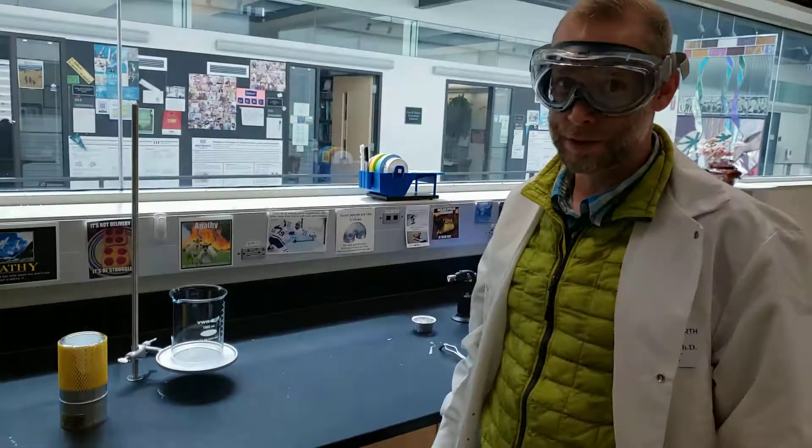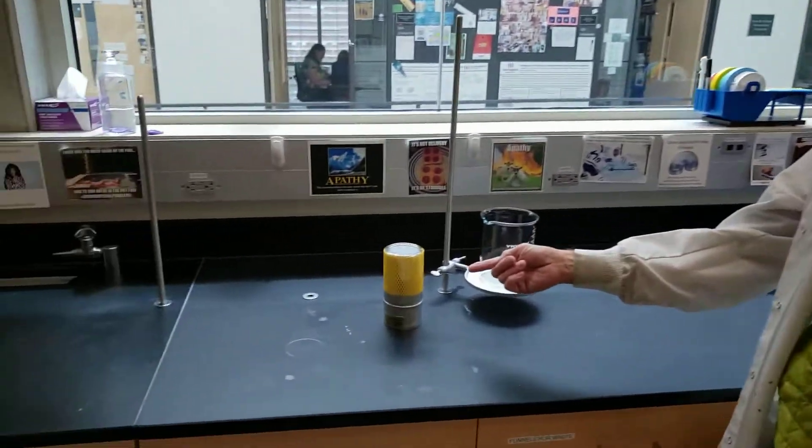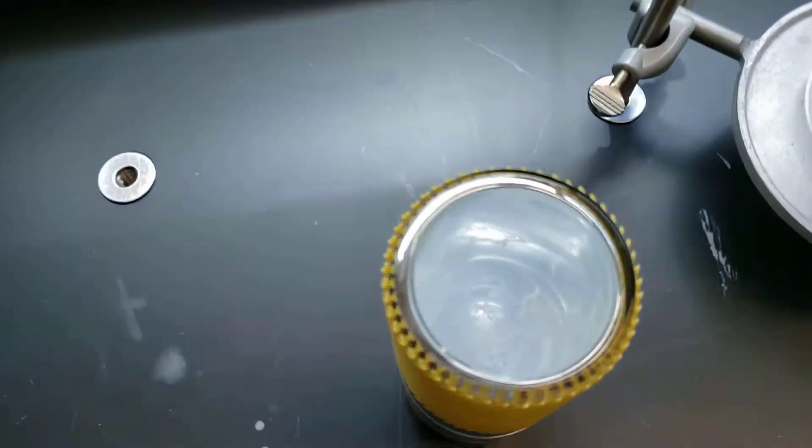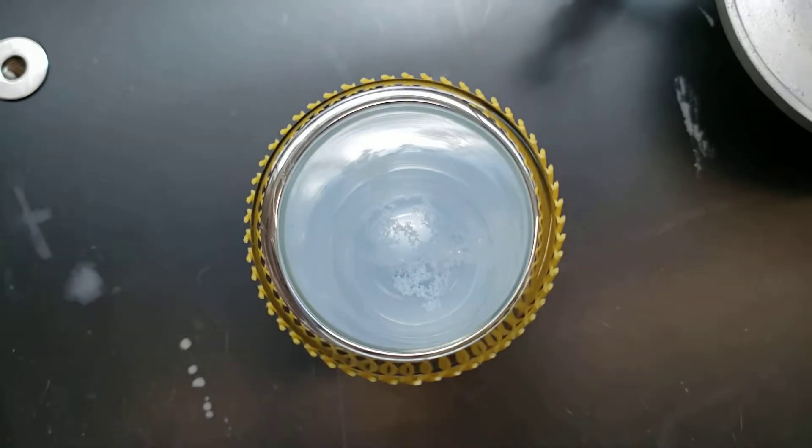So we made some liquid oxygen just now in the other room and I'll show you that it's really cool blue color. Hopefully you can see that.